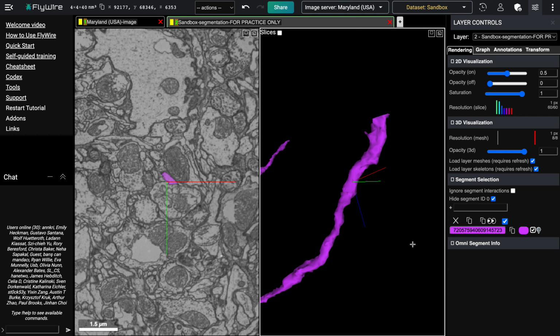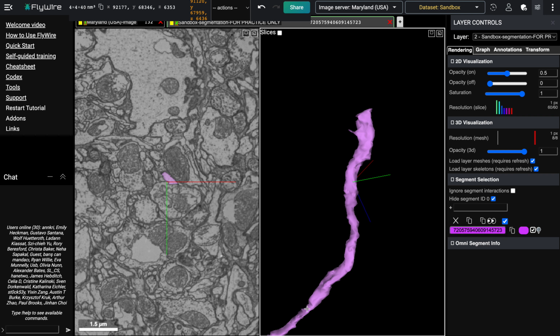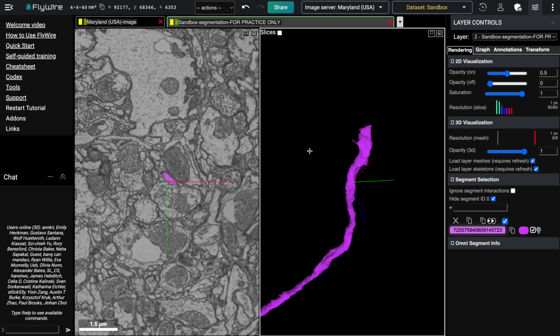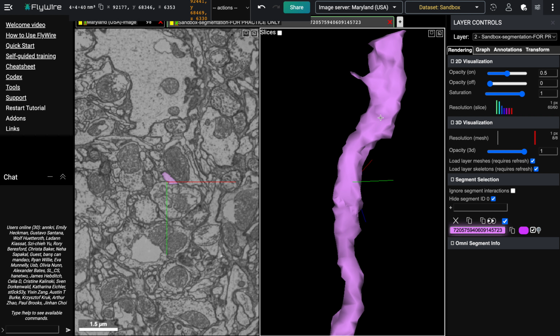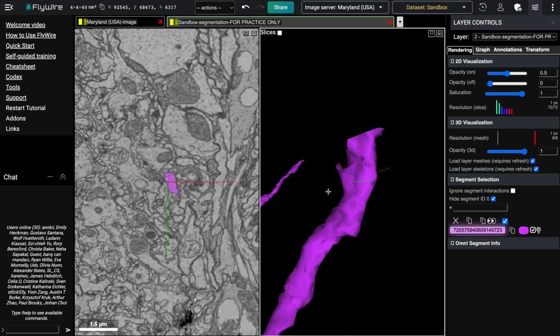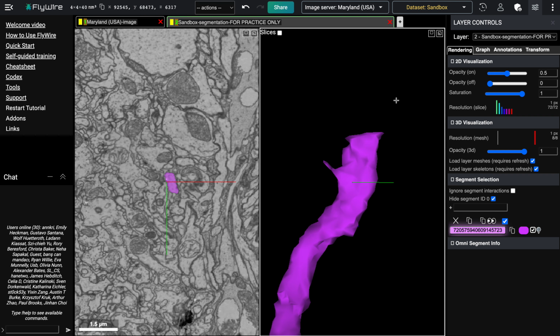All right, we're going to go over misalignments, which are common errors that you might come across when proofreading in FlyWire. For this example, we've got this branch here, which is continuing up from this cell body. And right here, we see that there is a break where the neuron has not continued. Part of the way that we can tell that this is not just a natural termination of the branch, but an actual mistake, is by the width of the area.